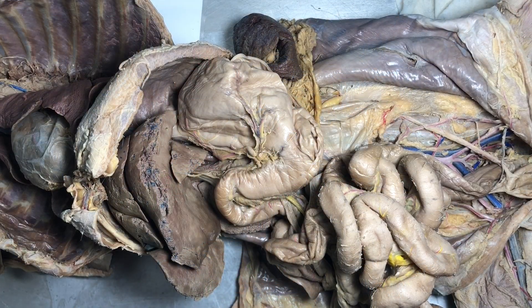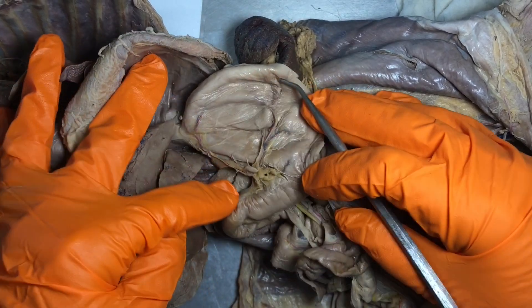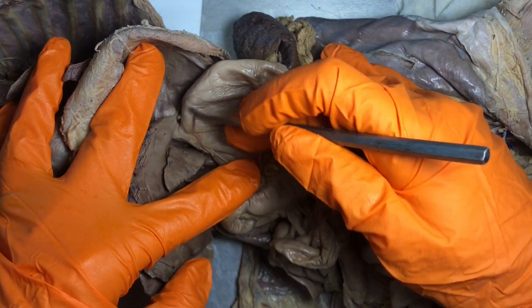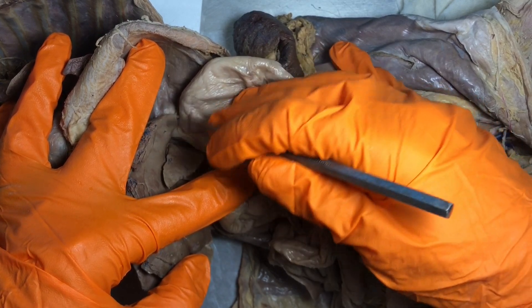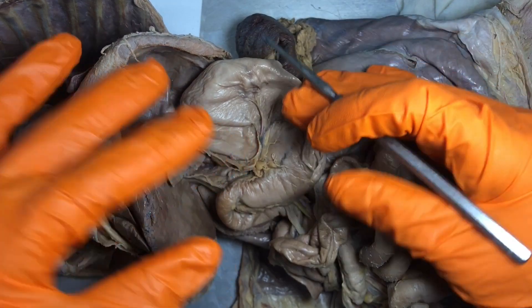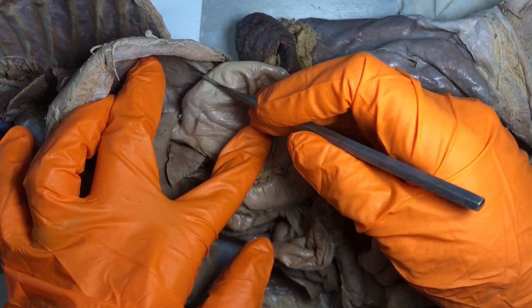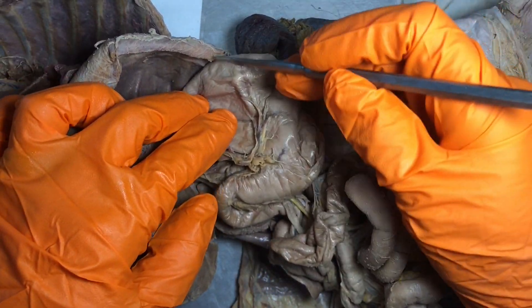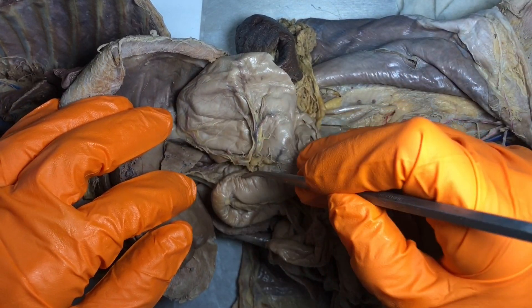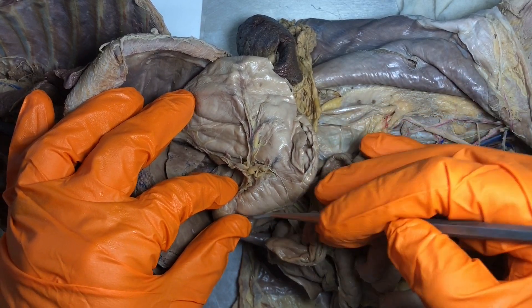Now we are in the abdominal cavity. Here are the different parts of the stomach. This area in humans we call the cardia. This is the fundus — remember that's that top kind of bulging portion of the stomach. This is the greater curvature, this is the lesser curvature, and then this end of the stomach is called the pylorus.